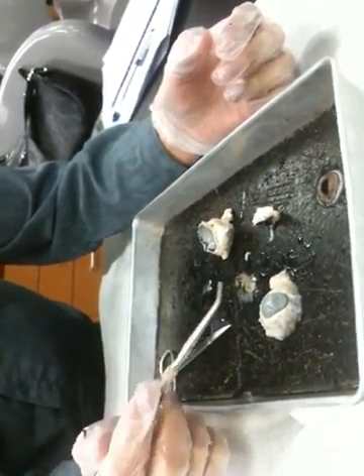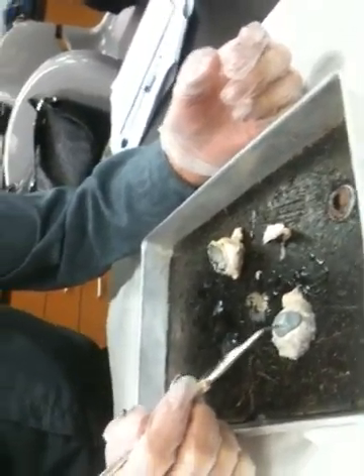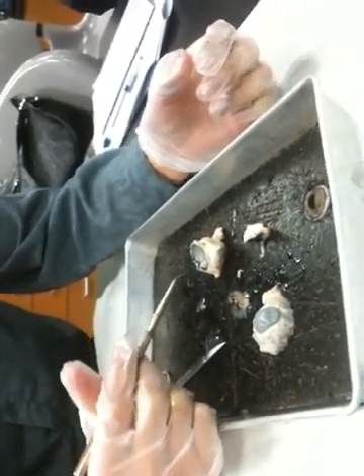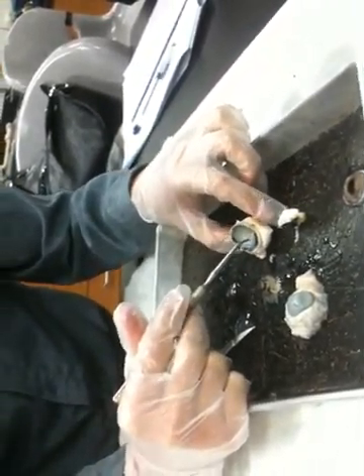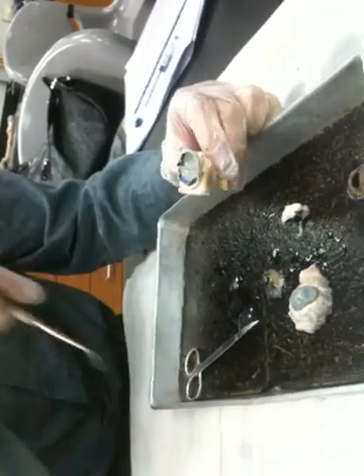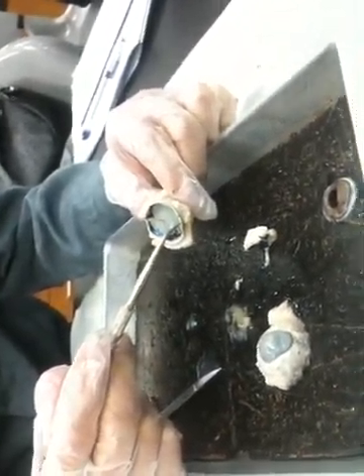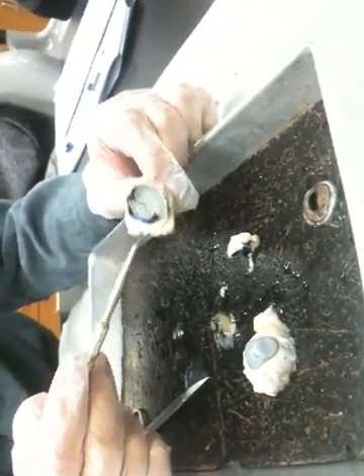Okay. We're going to switch over to the other side. The first thing we'll note is that there is a thin layer of this kind of creamy white material laying over the surface there. What's that creamy white layer? That is the retina. The creamy white material is the retina. That's the layer which contains the actual visual receptors, the rods and the cones.